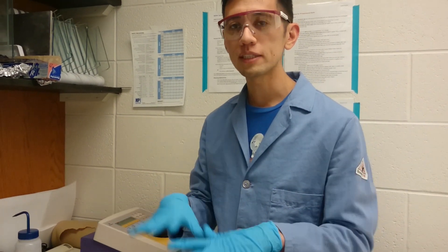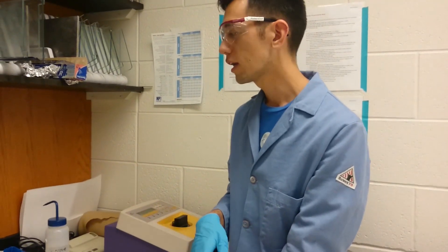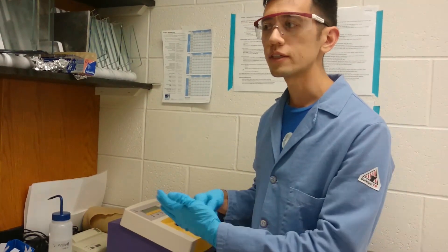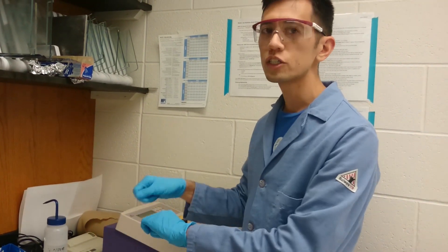I'm going to show you how to do basic manipulations with a scintillation counter and working with S35. This is our small scintillation counter that we use when we're doing experiments, and we need to check things routinely as we do experiments to check for contamination.